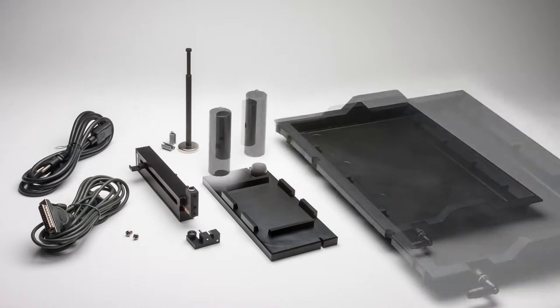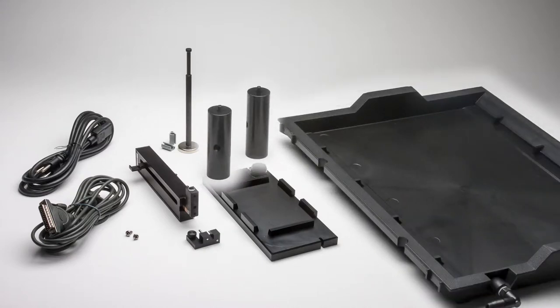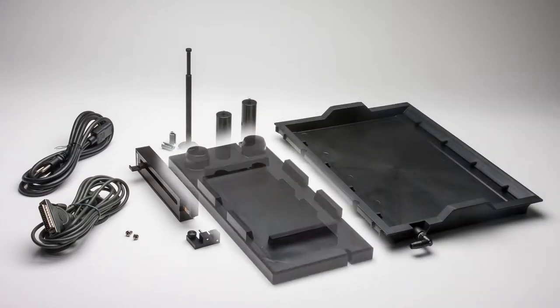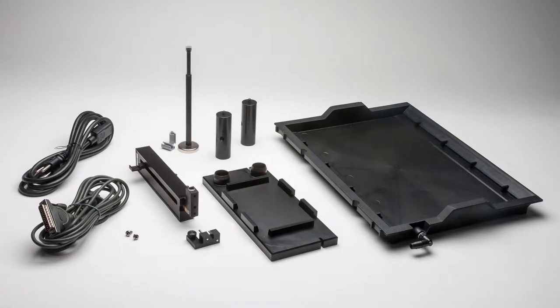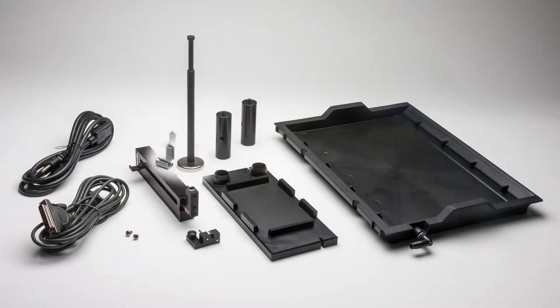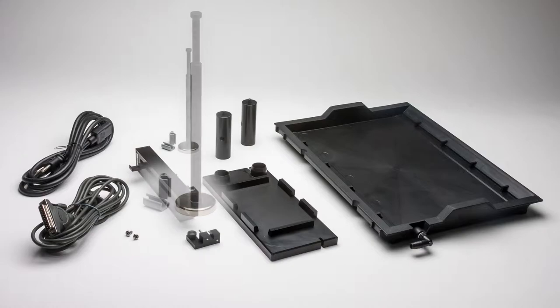The tray and its support posts, the well plate holder, and a cable guide with a magnetic base to support the electrode cable during the robotic arm movement.